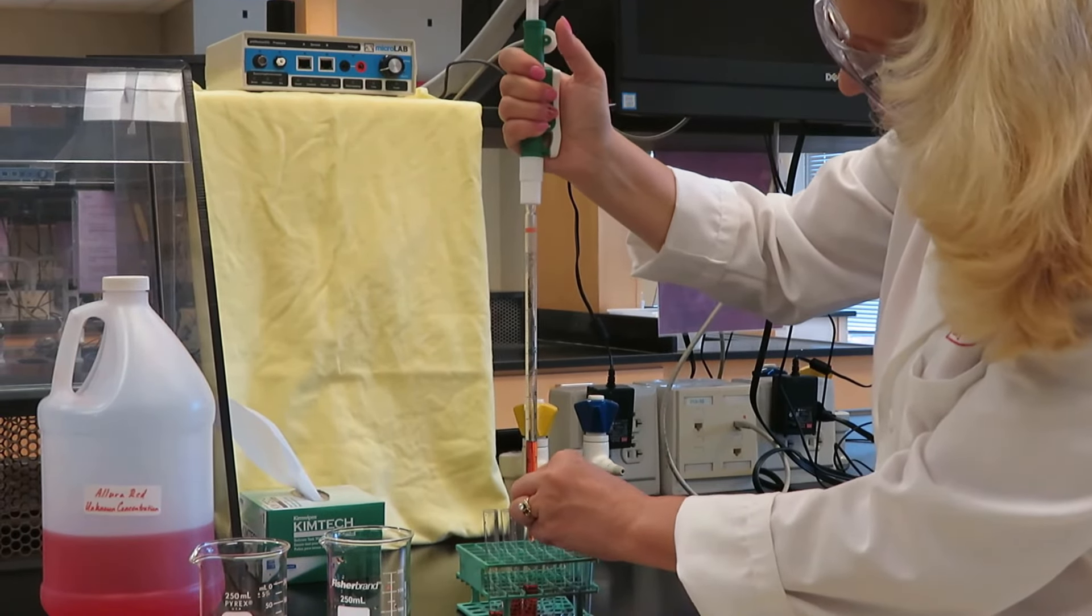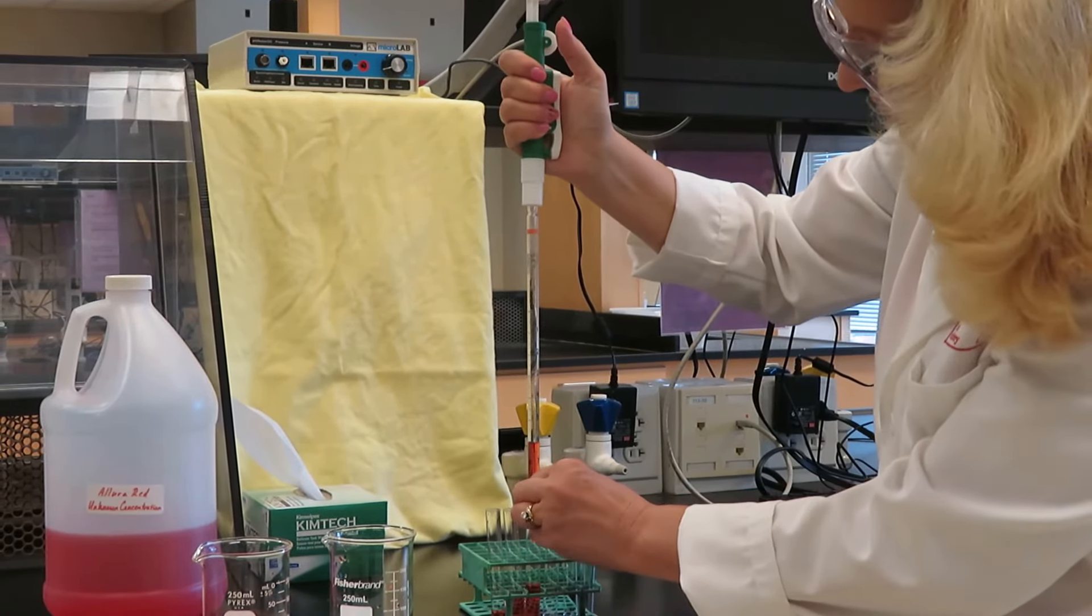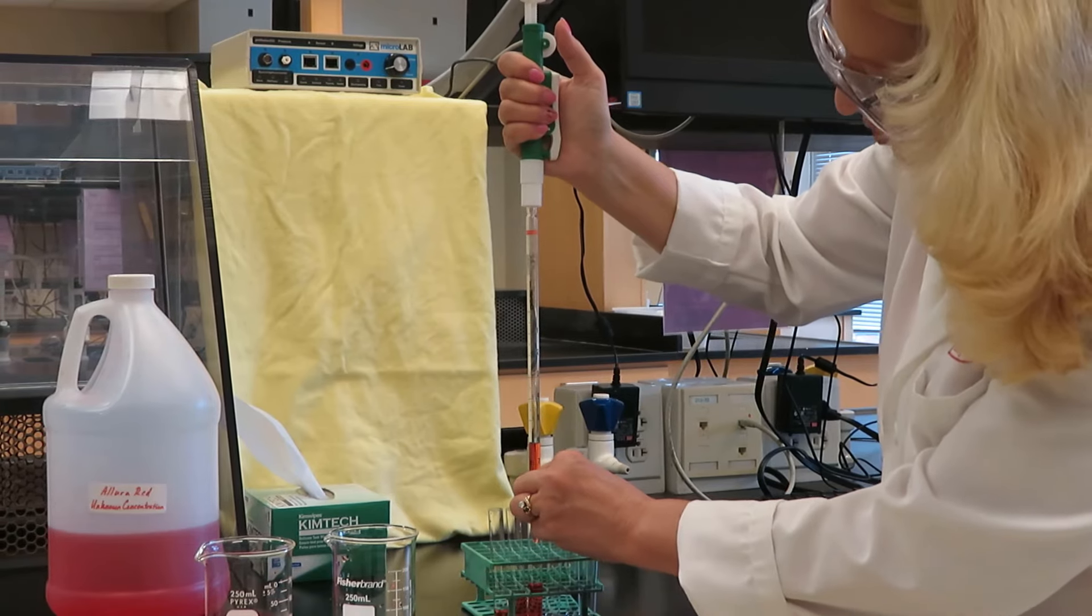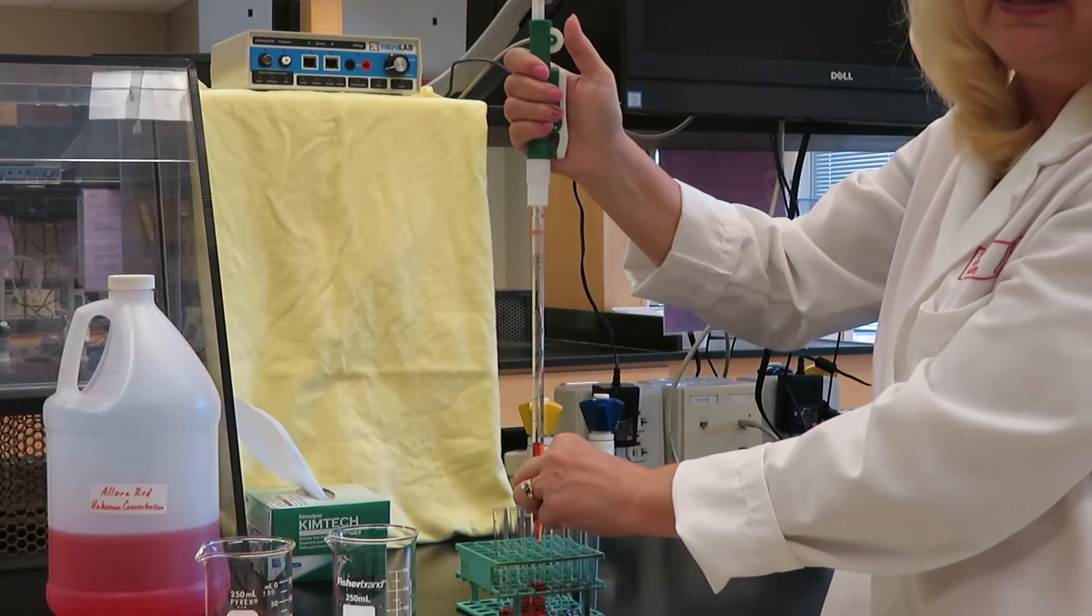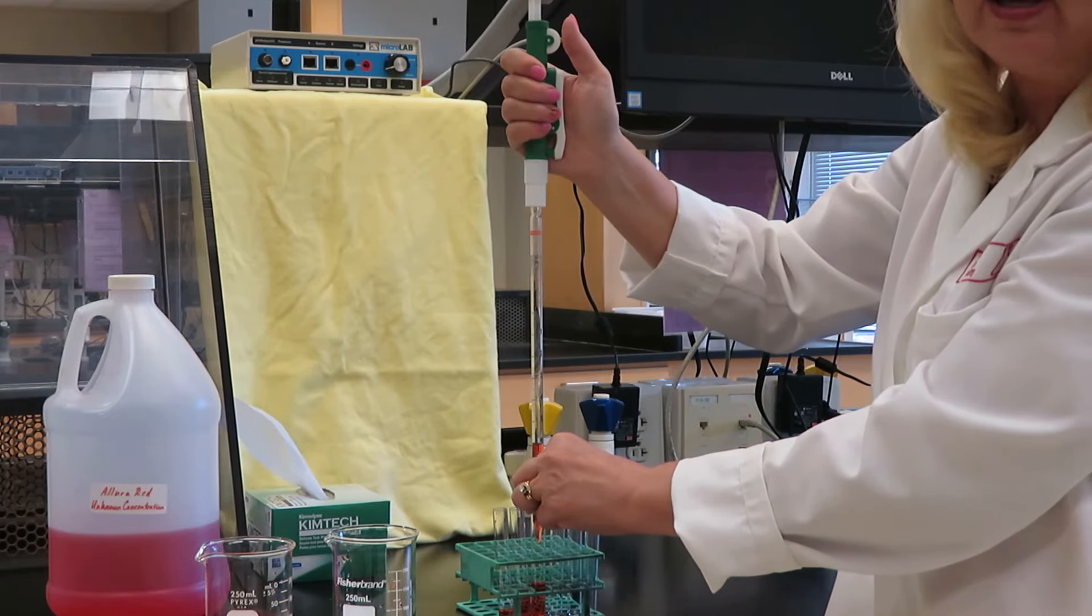And I'm a little bit over on that one. Obviously, I can't take it back up. So I will make that 3.05 milliliters when I document my data for my calculations.